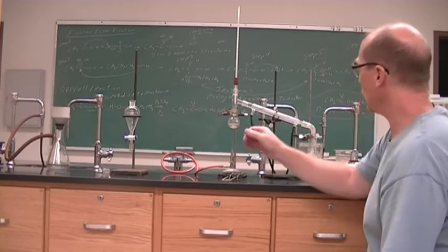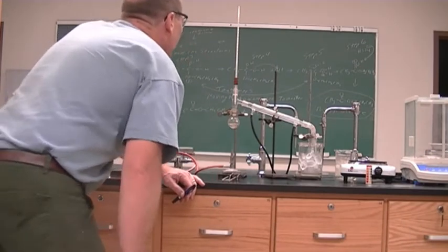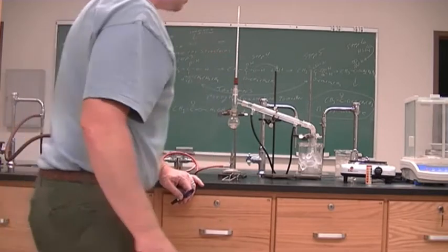All right, let's see where we're at now. Now we are at 40, 60, 80. We're right at 100 degrees Celsius now.